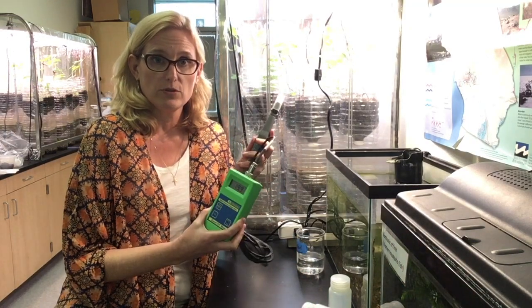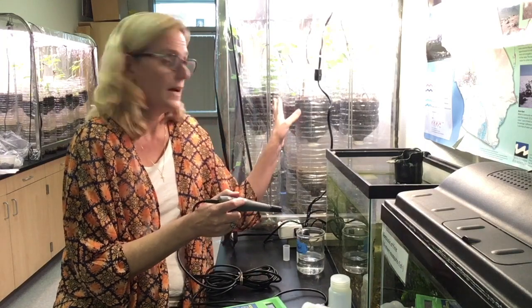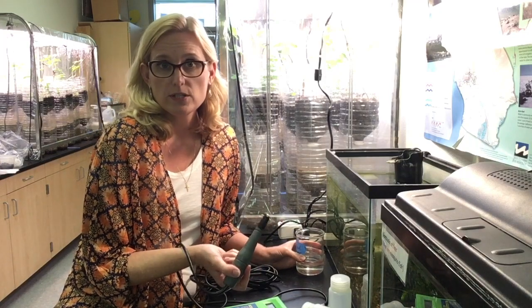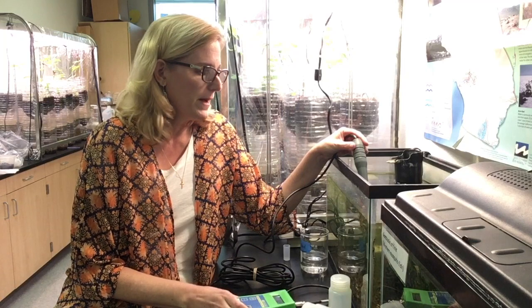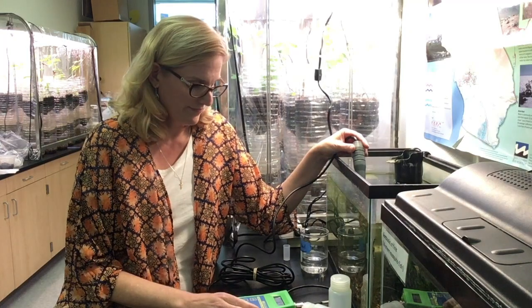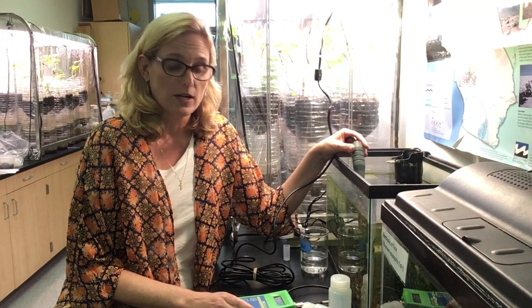The first thing I'm going to do is check the dissolved oxygen levels of the fish tank. The fish tank doesn't have fish in it anymore because the fish are all behind me in these eco columns. I'm going to rinse my dissolved oxygen probe in distilled water and then measure the dissolved oxygen of my fish tank. I have my dissolved oxygen meter here and it will take about a minute for me to get an accurate reading. The reading I have is 7.4 on my dissolved oxygen meter — that's my beginning dissolved oxygen level.